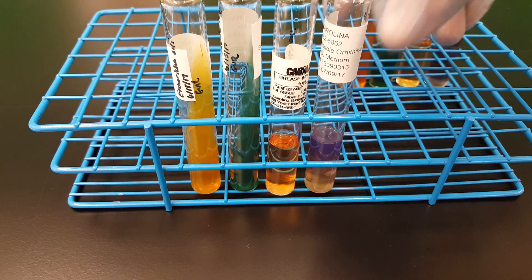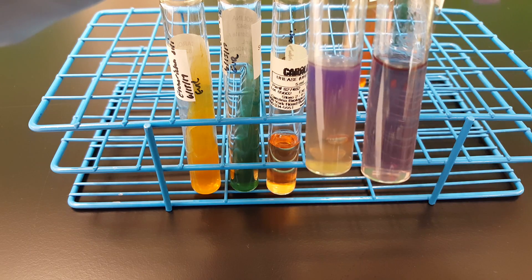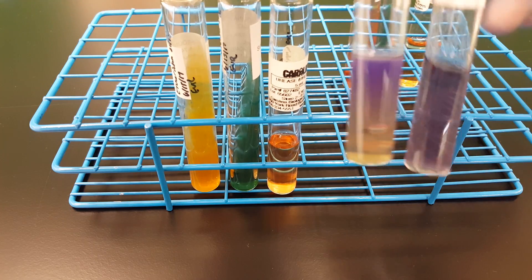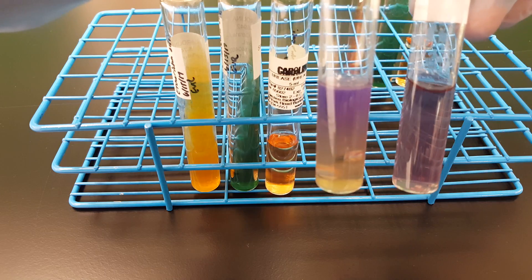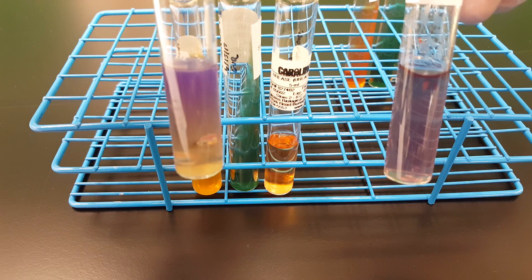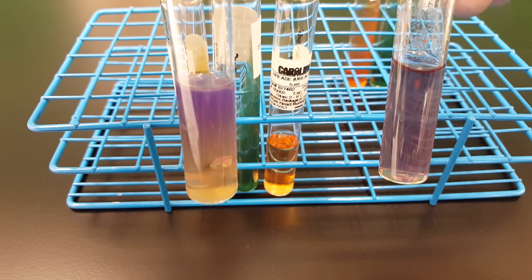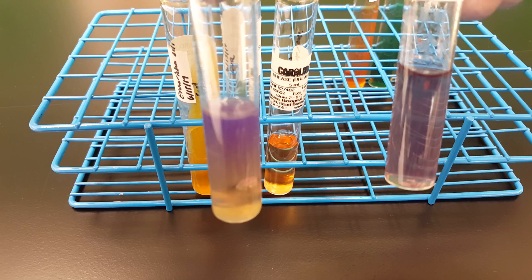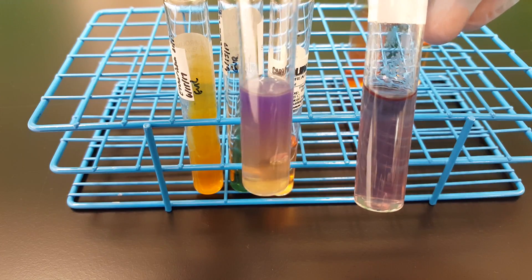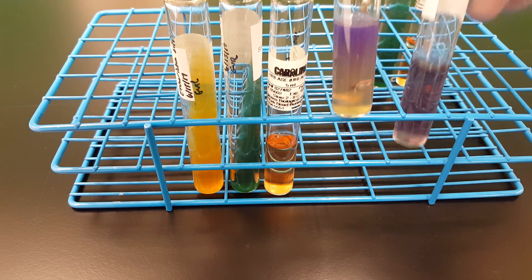Moving to the next tube, we have the MIO tube. The MIO tube starts out as this purple, clear, semi-solid media, and remember we stabbed it with the needle. We're looking for three things in this tube. First, we're looking at the stab line — if there is cloudiness of the agar and growth away from the stab line, that indicates the organism is motile. Hence the M of MIO stands for motility. The I stands for indole, and I have to add a reagent for that.